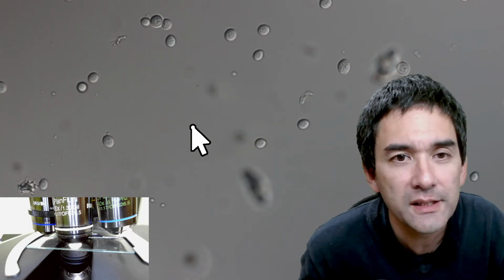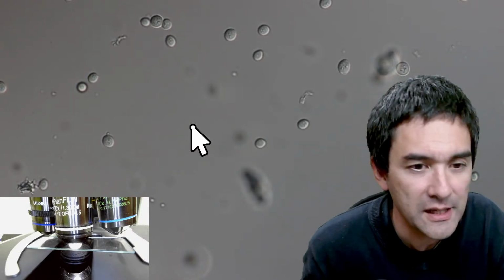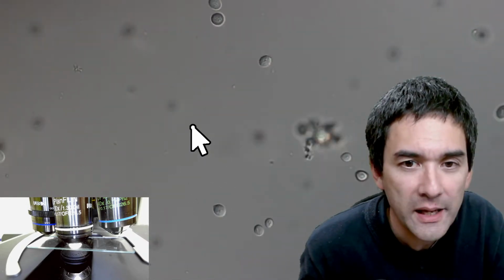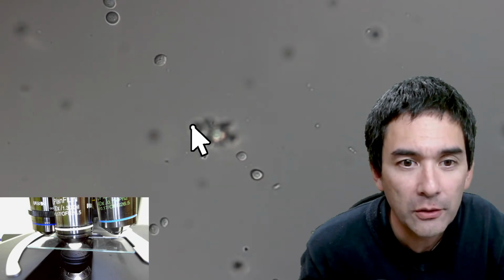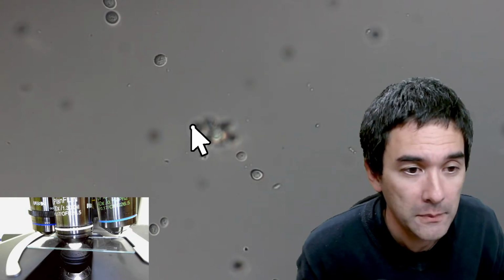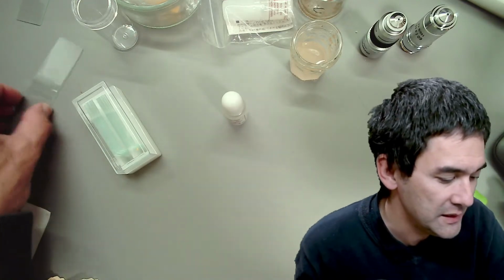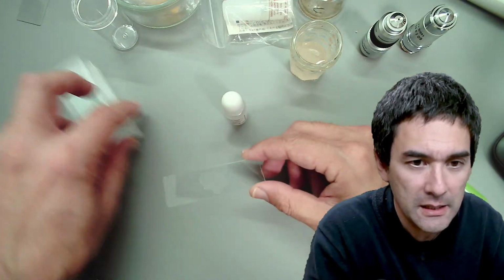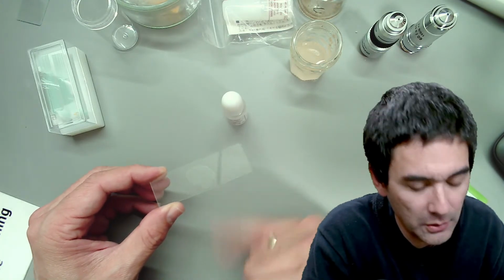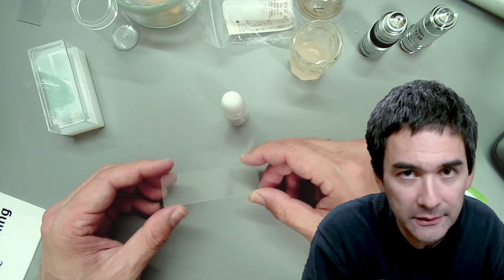Okay, so this is basically another thing, and I would like to show you now a little bit of heat fixing, how this actually works. This is the standard way that you use for preparing bacteria, and I guess also yeast. So I'm going over here again to the desk, and what I've done here is I've applied a yeast suspension on the slide, and I allowed it to air dry. That's it. No heat applied, no nothing.